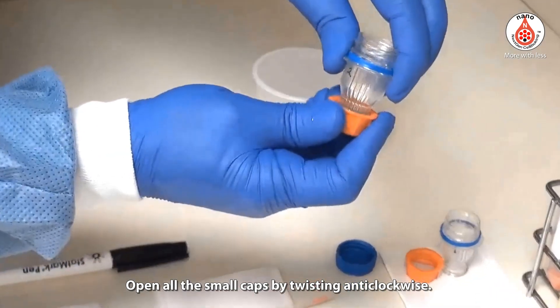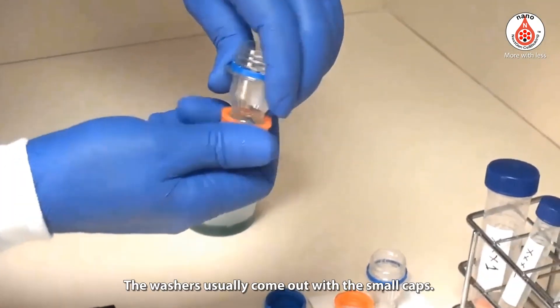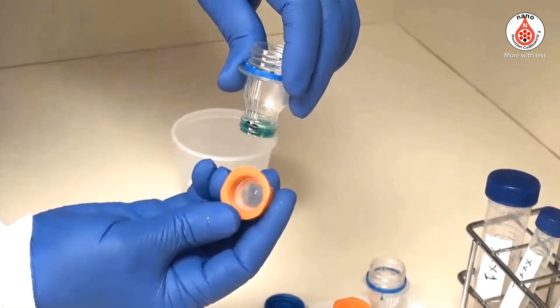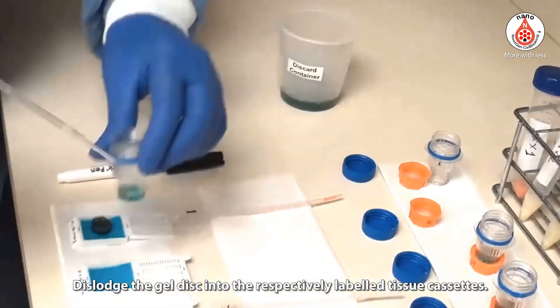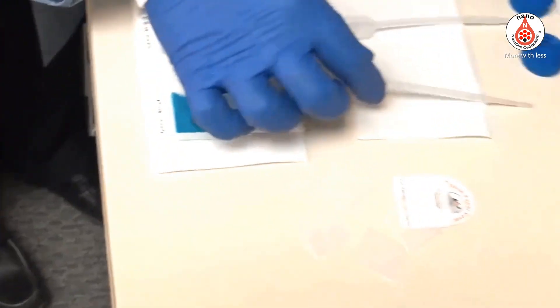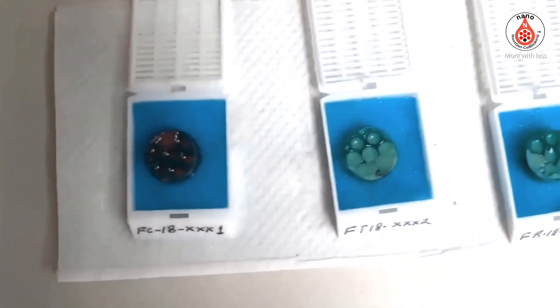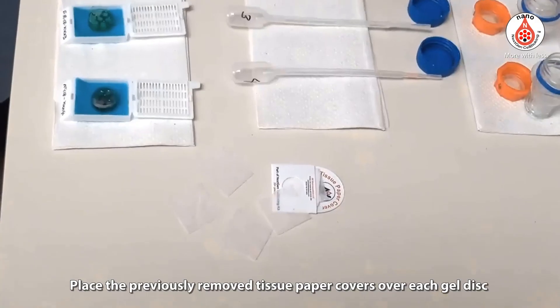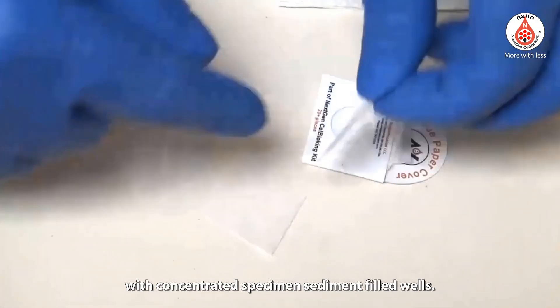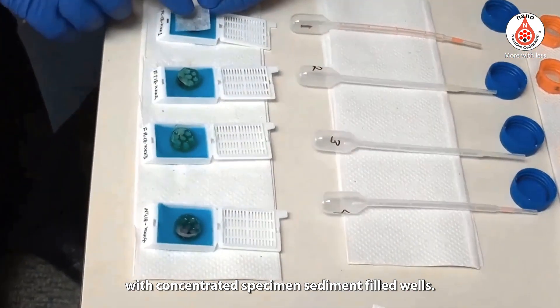Open all the small caps by twisting anti-clockwise. The washers usually come out with the small caps. Dislodge the gel discs into the respectively labeled tissue cassettes. Place the previously removed tissue paper covers over each gel disc with concentrated specimen sediment-filled wells.